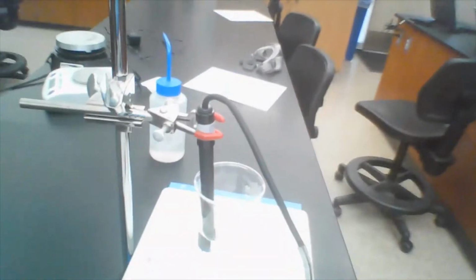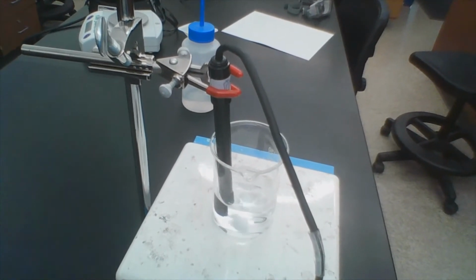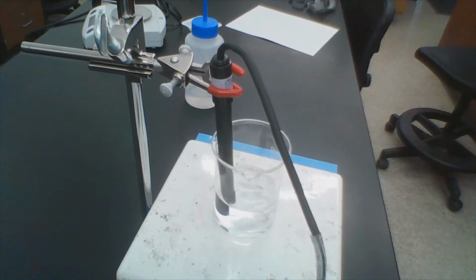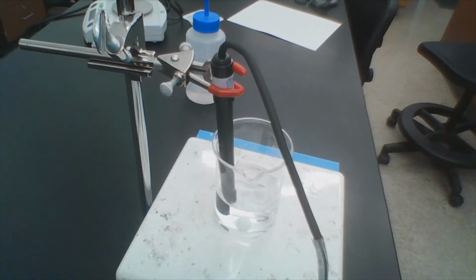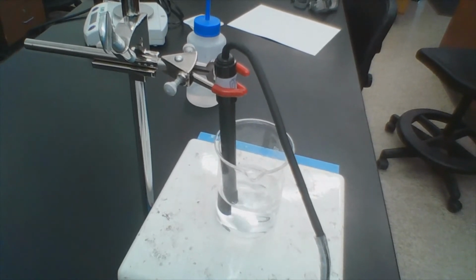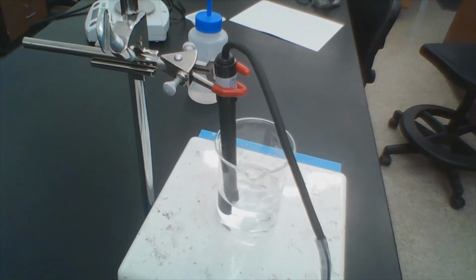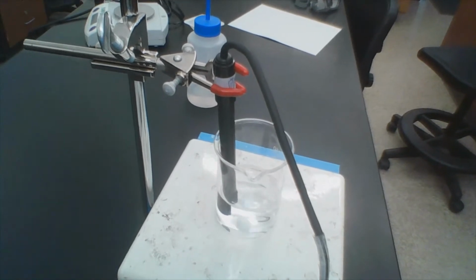So what I'm going to be doing is taking 1 drop at a time of each solution. And so this first one we're going to do is sodium chloride. And as I add each drop, we'll get a new conductivity value. And we're going to see how the conductivity value changes by adding more drops. So first I'll put in 1 drop, then I'll put in a second drop and tell the computer it now has 2. Then a third drop until it has 3, and so on and so forth.